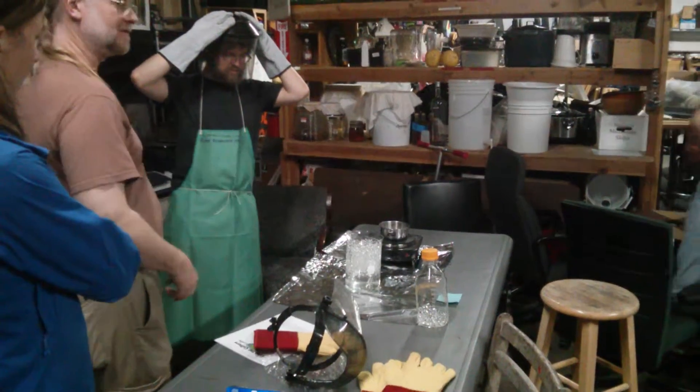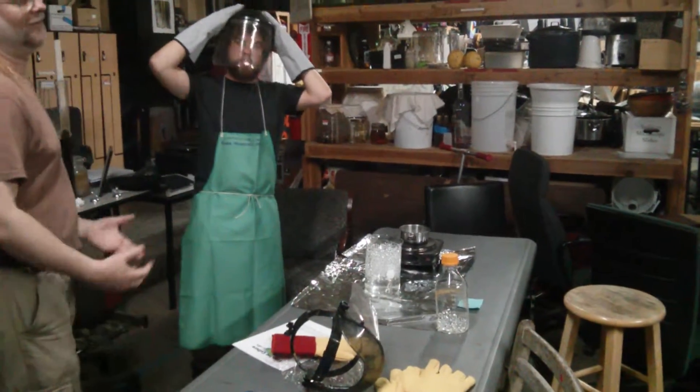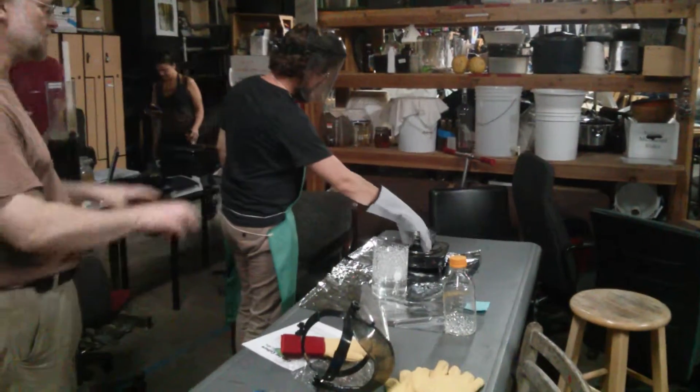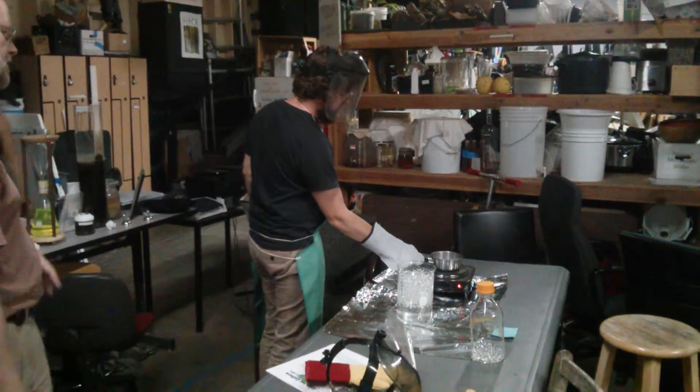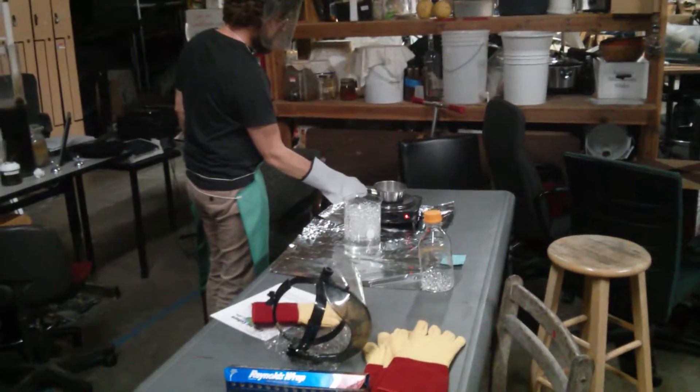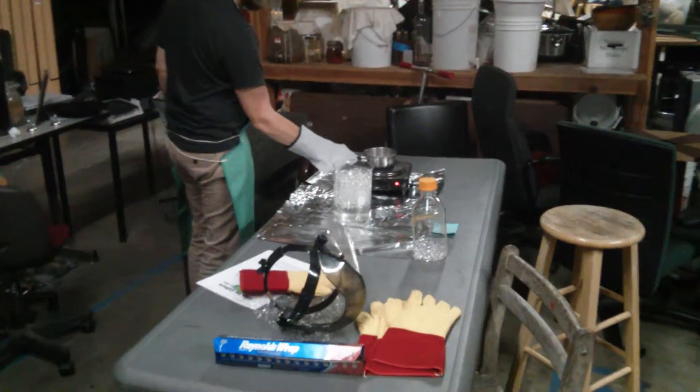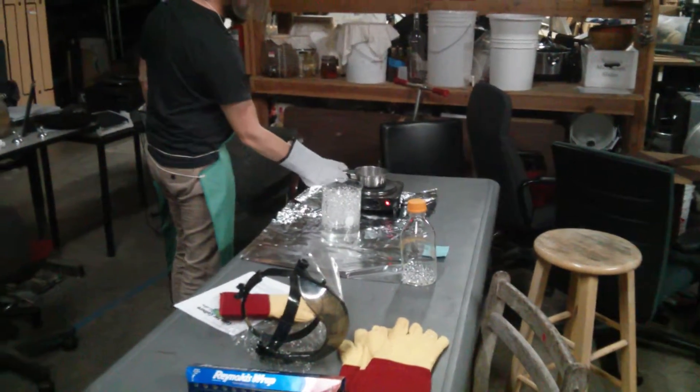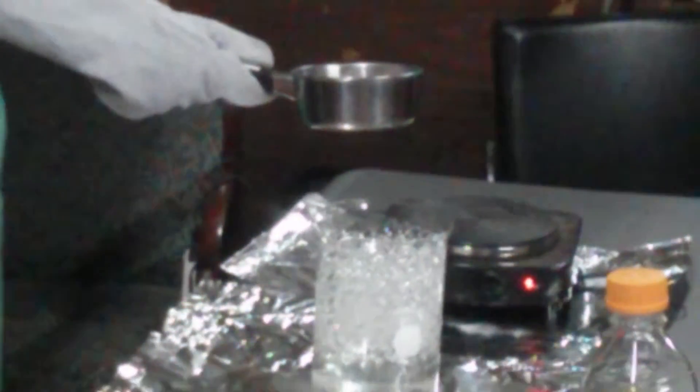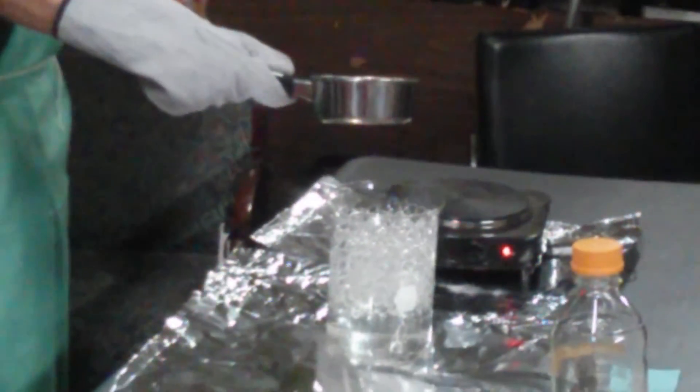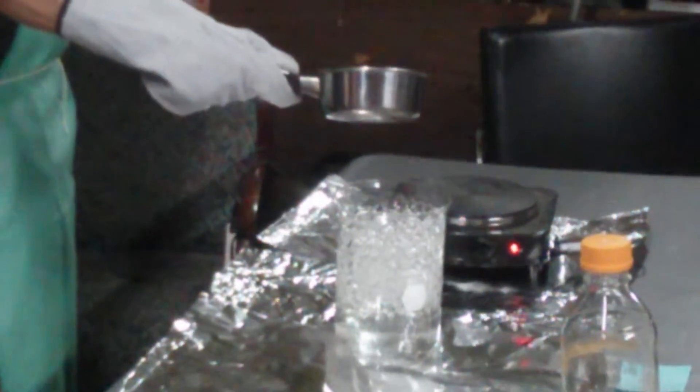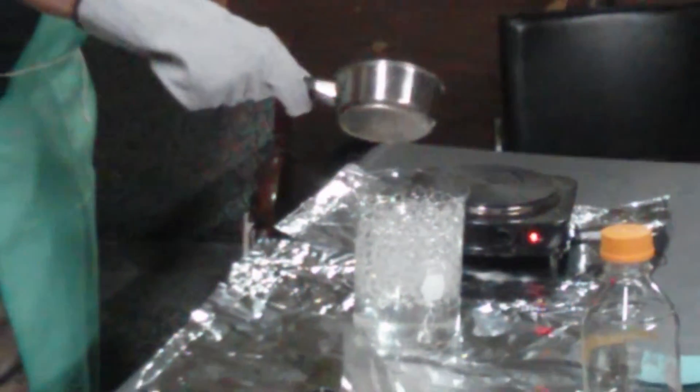It might splatter all over the place. You might get some splattering of the metal as well, which is why you should be standing back. You're very brave. Try to pour it exactly in the middle if you can, which is why it'd be nice to have a pouring spot on there. Not from quite as high, maybe.